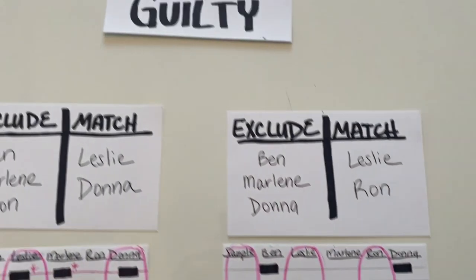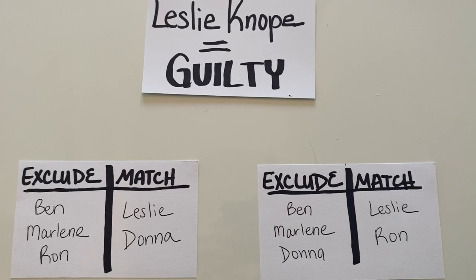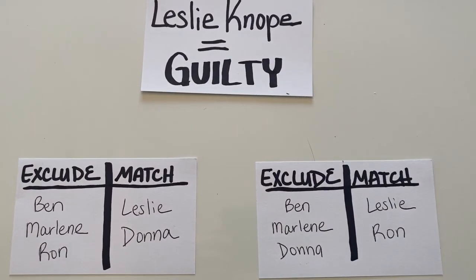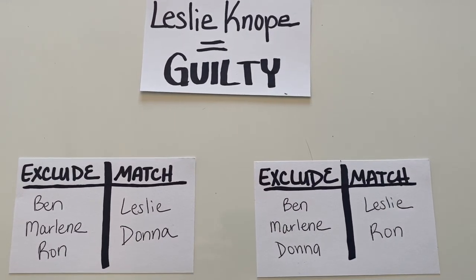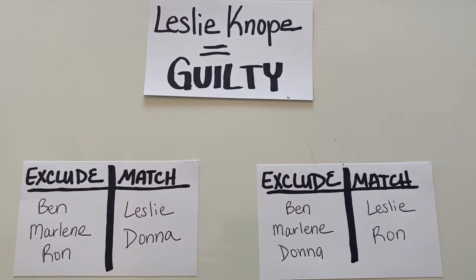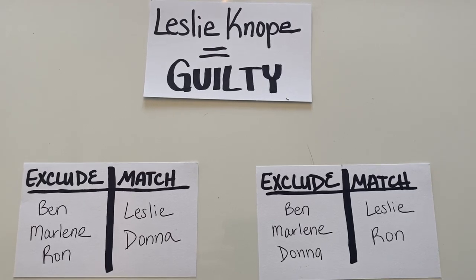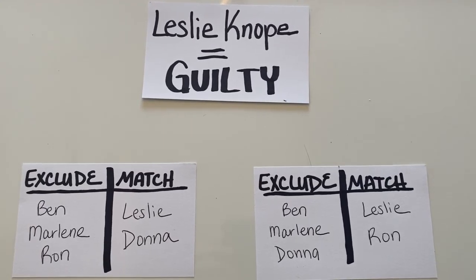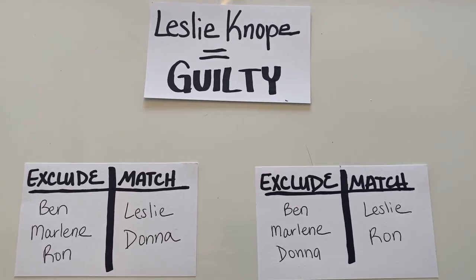However, when we combine all of our results, we find that only Leslie is a full match at both loci. Therefore, she is guilty.